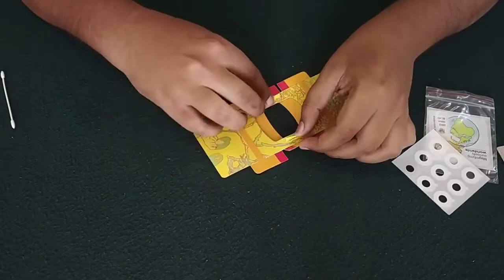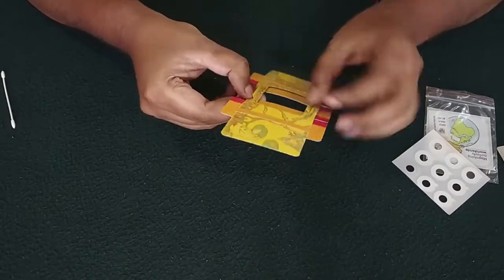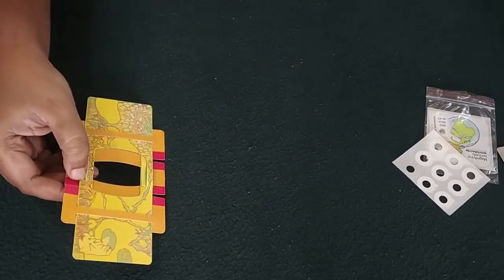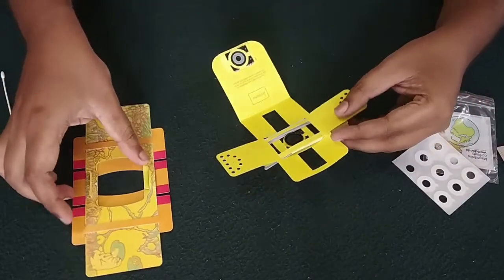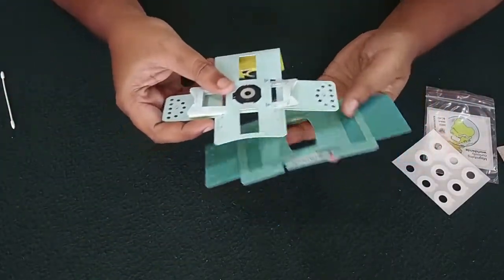After this part, it's the last stage of our assembly. For that, we will take our main guide and this part. We will assemble it like this.